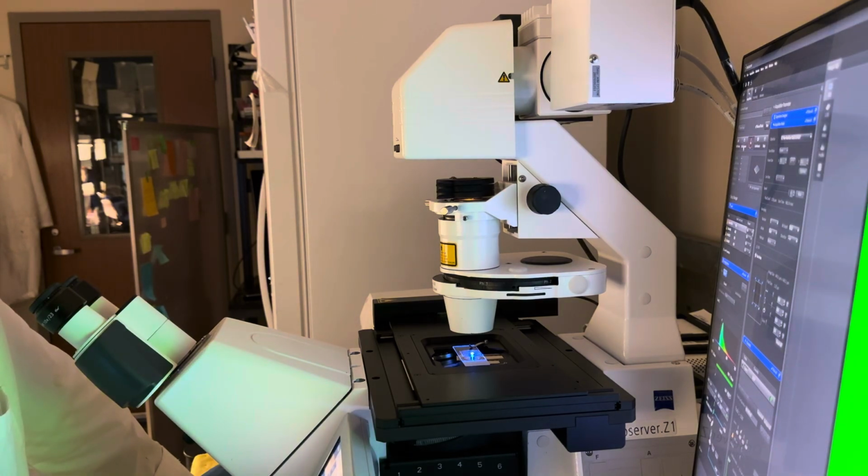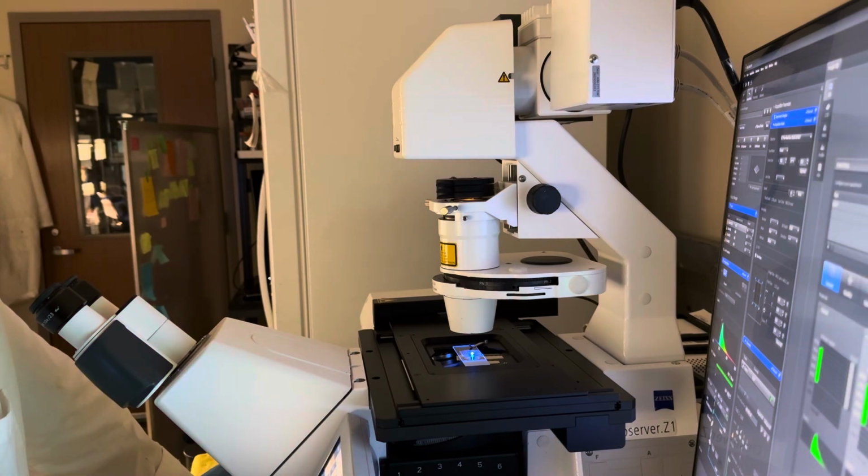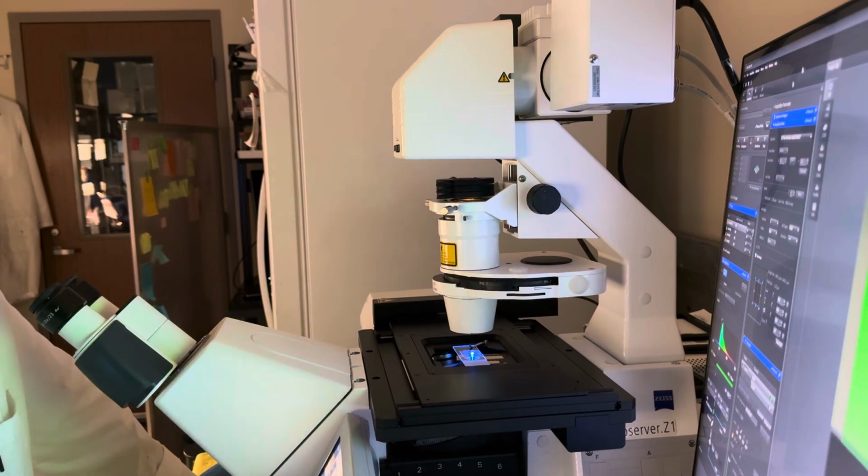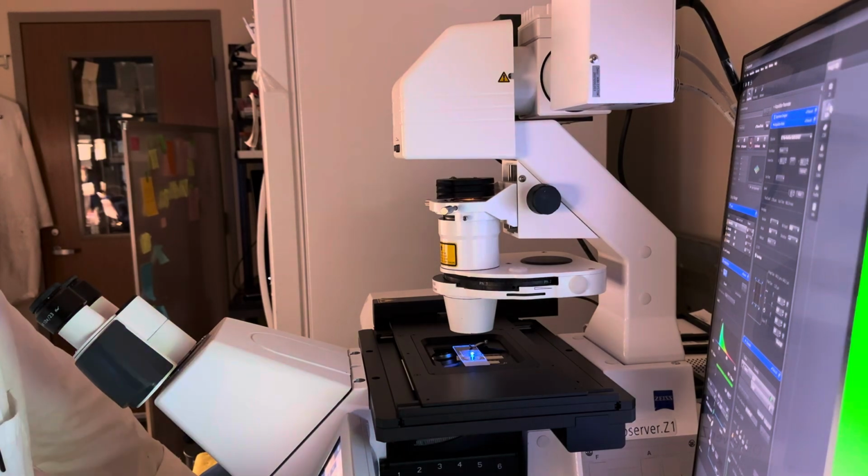and there'll be a smart setup where you have to choose the fluorophore and the type of color you are expecting to see. So the first thing I'll do is I'll select the worms and then use the live mode. I'll bring the exposure down. I'll use also a bright field channel to see the worms first, and then use the other channel to split.